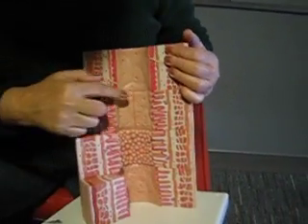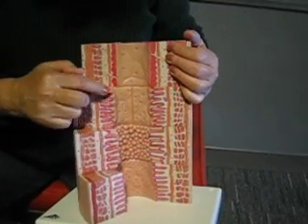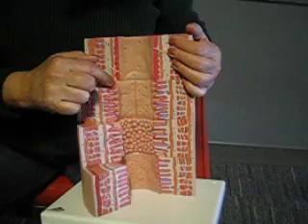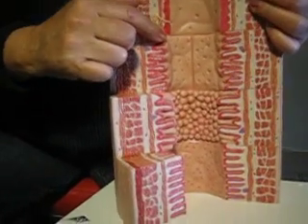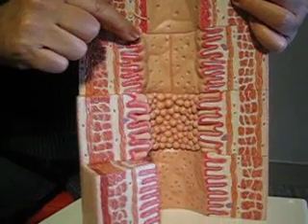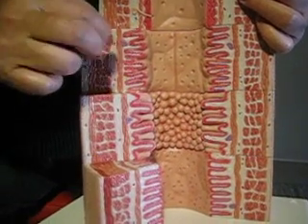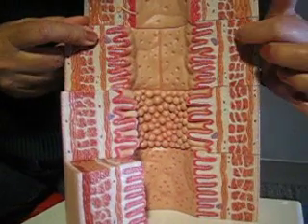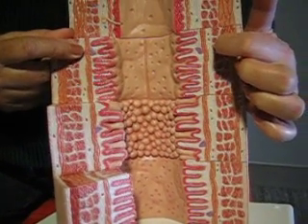When we get to the stomach, we have a transition because we go from having stratified squamous to simple columnar. And the tissue is going to stay simple columnar all the way through the rest of the GI tract until we get to the anus, where it goes back to stratified squamous. So here, the stomach also, instead of having 2 layers of muscle, we have 3 layers of muscle, an extra inner oblique layer.